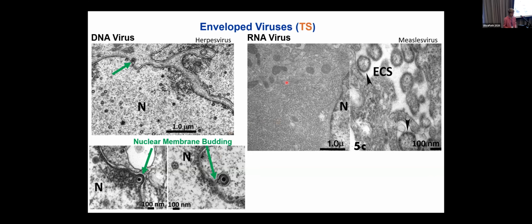It's out here, and you may not recognize it as a virus because this is an example of the measles virus that I just showed you by negative staining. It has the wormy-looking structures as the nucleocapsid, like a telephone cord. And here's the virus factory.